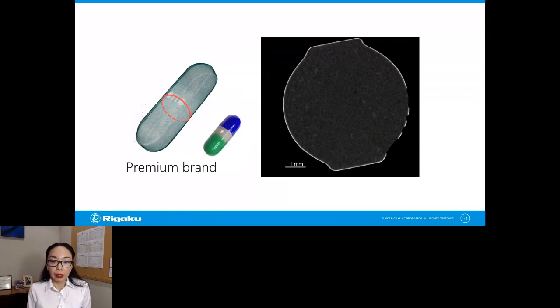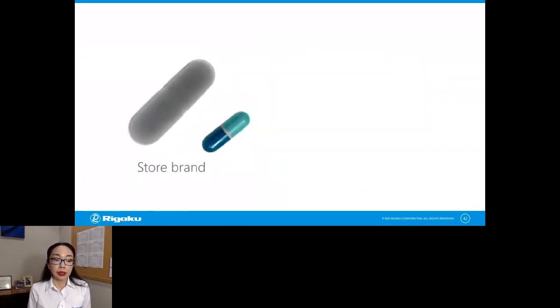So this tablet has this coating, which is probably protecting the active ingredients in the tablet. But it also has those openings of the coating. And those openings are exposing the active ingredients to the surface. So I guess the drug gets released very rapidly when you take this. So this makes sense.